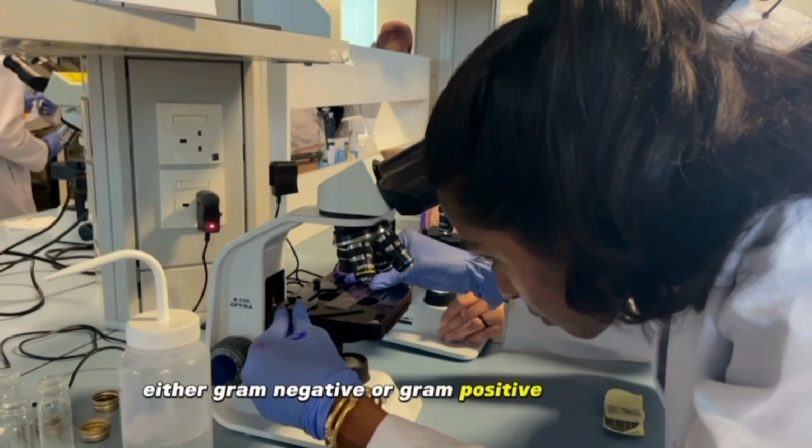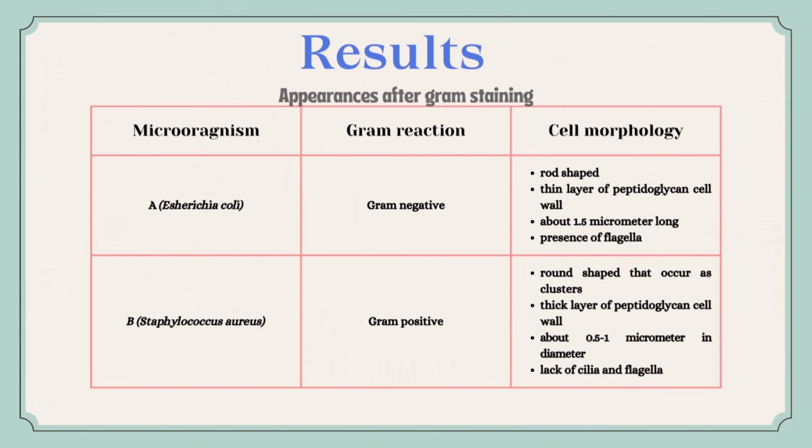Finally, the slides are examined under the oil immersion objective, aiming to identify cells displaying either Gram-negative or Gram-positive appearance. This is the result obtained after viewing the microorganisms under the microscope.